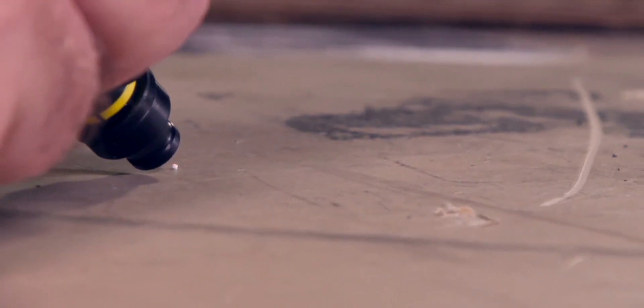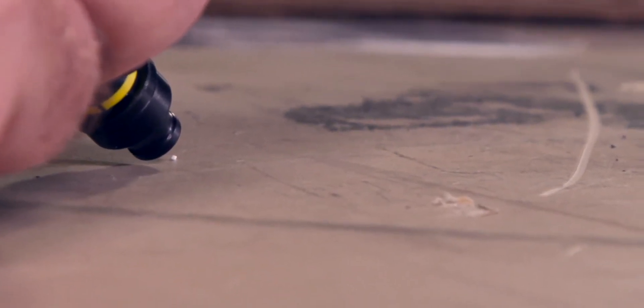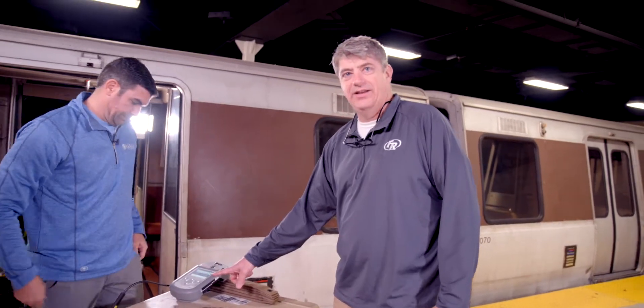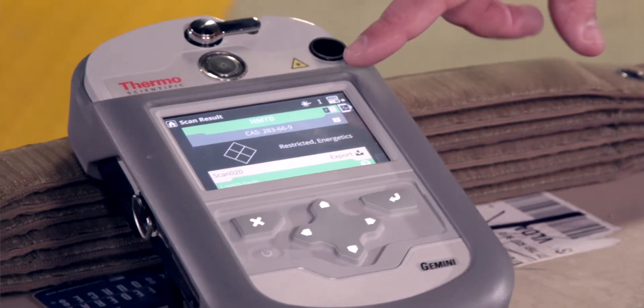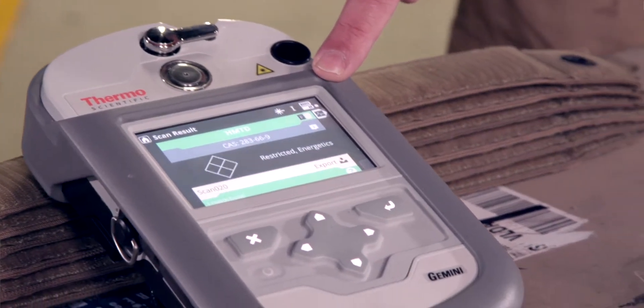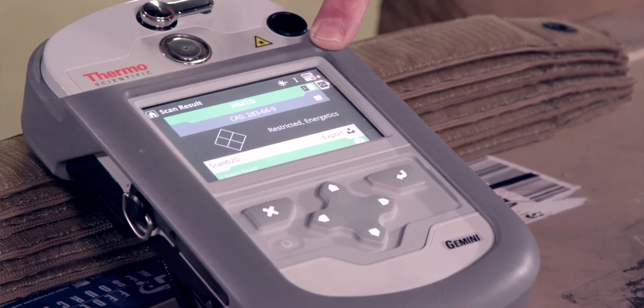He has better eyes than I do, so he might be the best one to do this. It's already done. Once you get this progress bar here, the instrument has already made an identification. That quickly, within a matter of seconds, we have our answer.